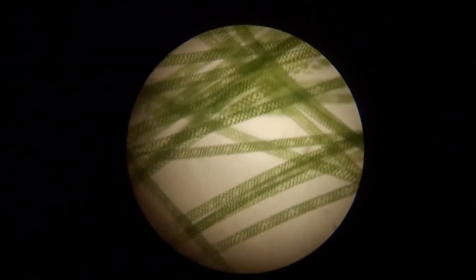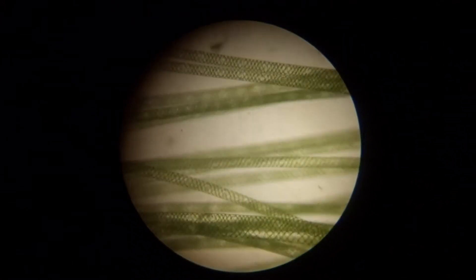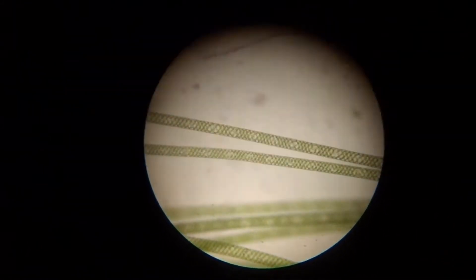This is under 100 times magnification. Looking for any diatoms such as Navicula — obviously it's darker because we've modulated our light source. We'll move this slide around and see what we have.